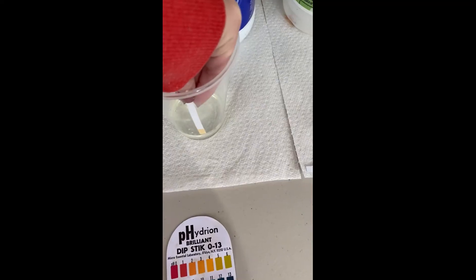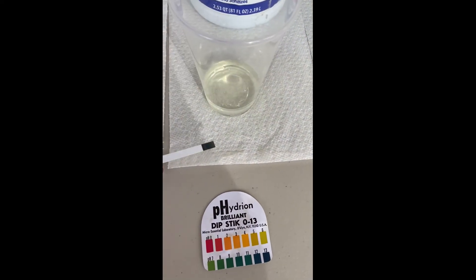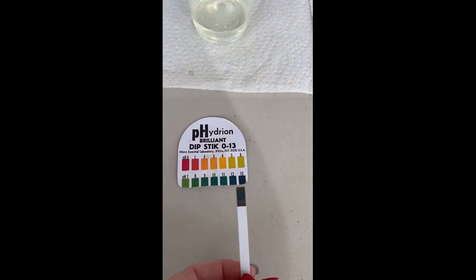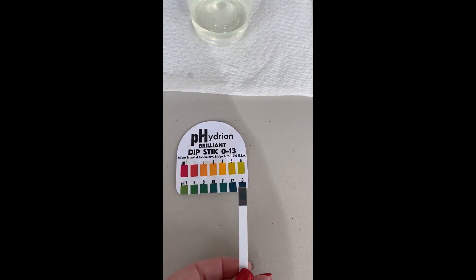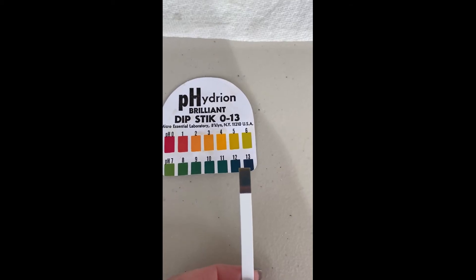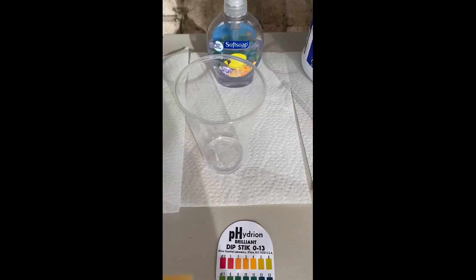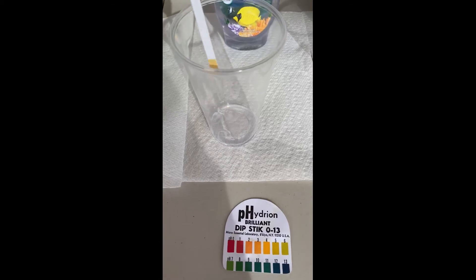We have bleach, and we're dipping it in, and instantly it's a very, very dark greenish-blue color. All the way at the end, it's either going to be somewhere around a 12 to a 13, most likely that 13 range. So very, very strong base.